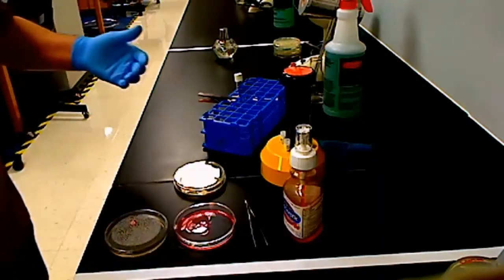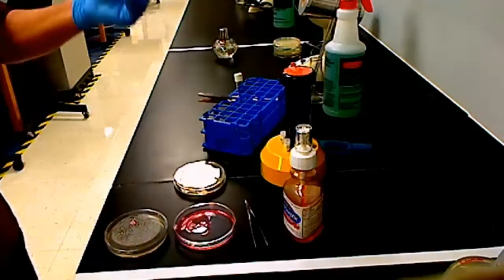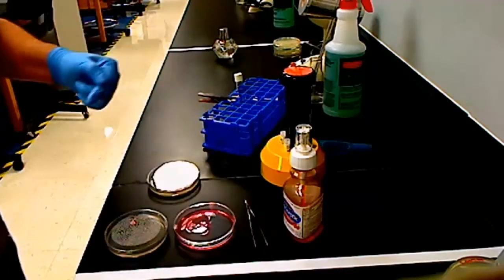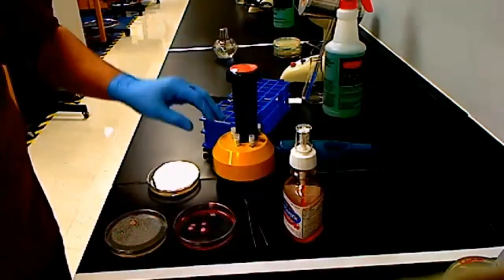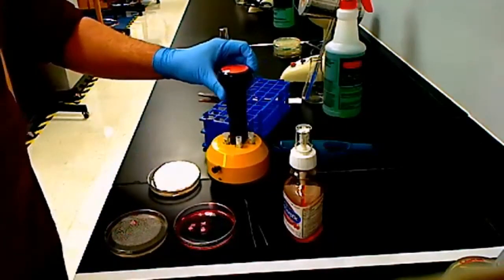For the actual antibiotics lab, it starts off the same. You have your 3 plates of Staphylococcus aureus, E. coli, and Pseudomonas already inoculated. What you're going to do is there's going to be a different station, it's going to contain this little antibiotic disc dispenser. This one's actually going to be faster. It's going to be easier to actually do it because we have a dispenser that will put all the discs on the plate. And in this case, we're using 4 different antibiotics.